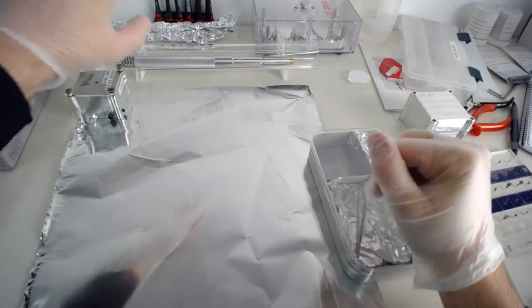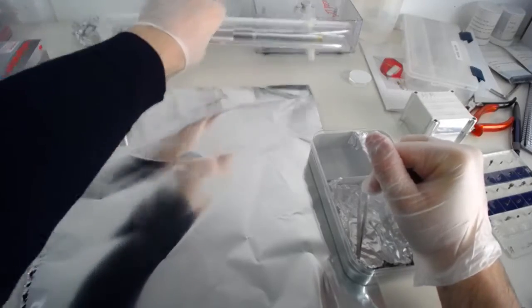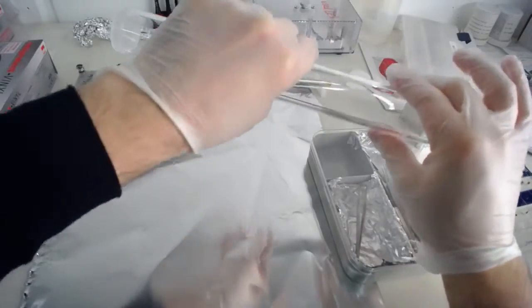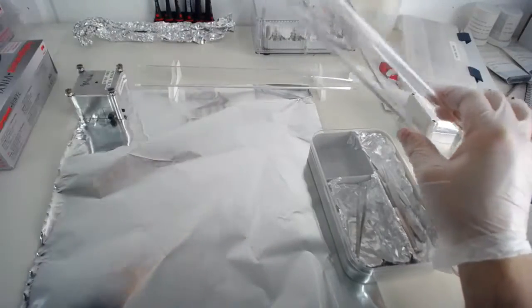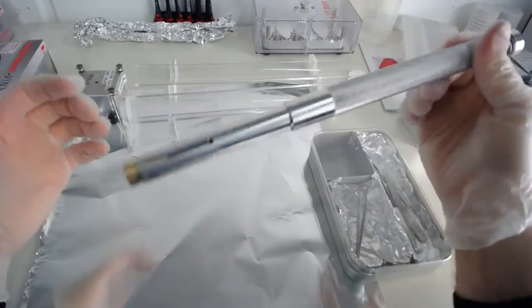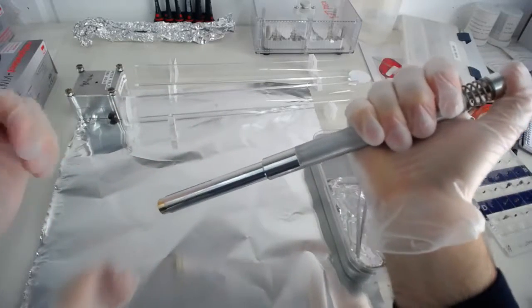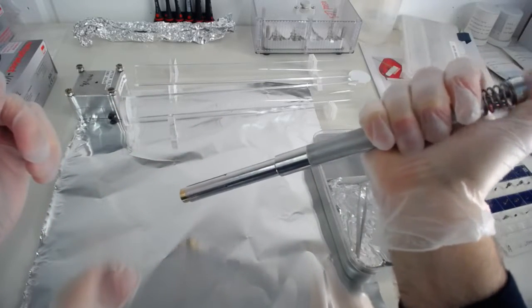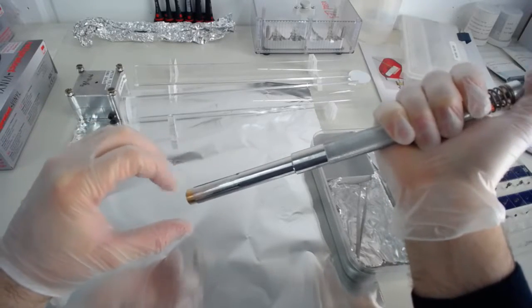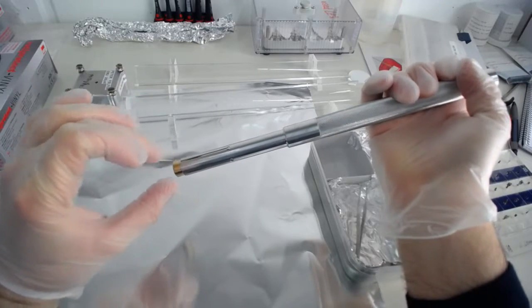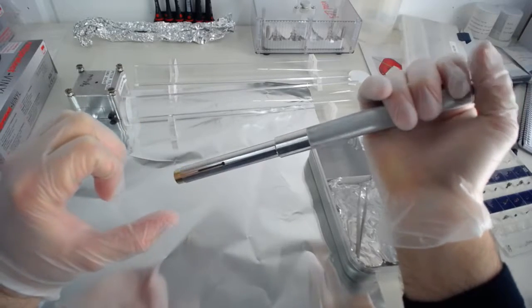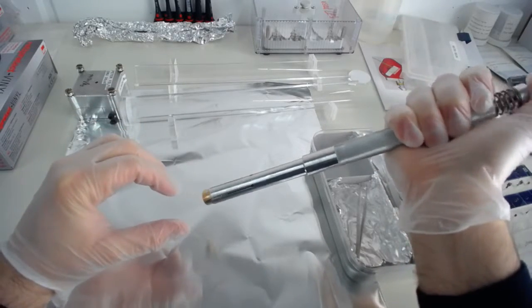So this is what we need to move the specimens around. And now we're going to get the specimens. In order to get the specimens out, we've got this transfer rod here, which we've got in a little thingy that protects it from dust. And the transfer rod has a simple action. It's got a little button at the end. If you press it, a cone comes out and when the cone goes in, it opens up the little tube thing here. And this is how it jams onto the specimen carousel.